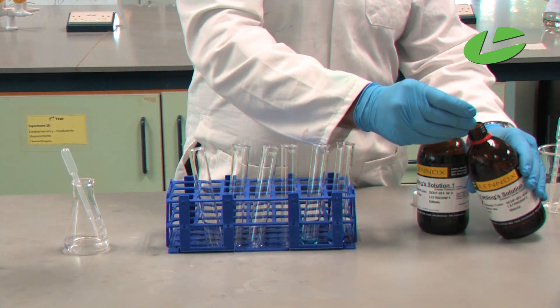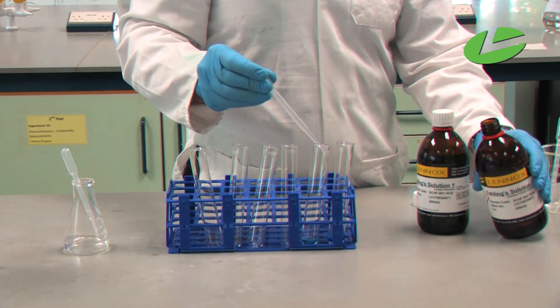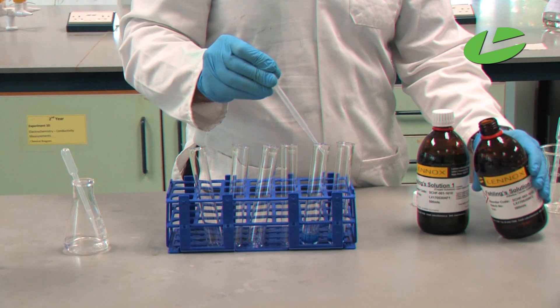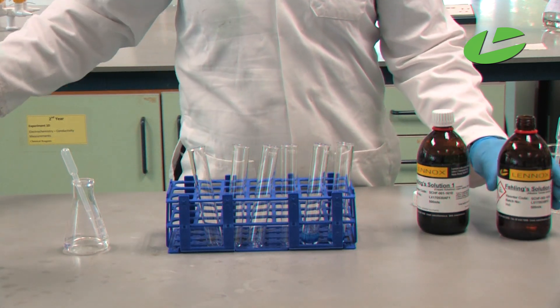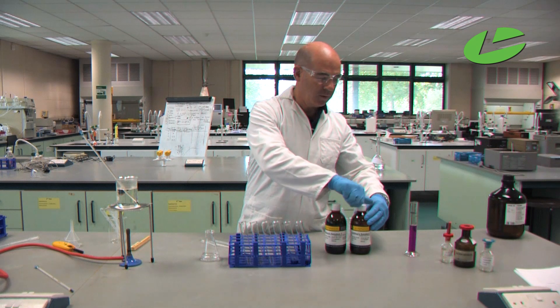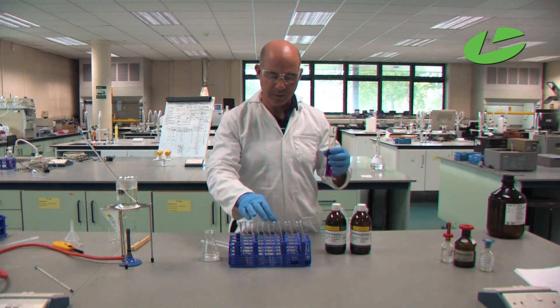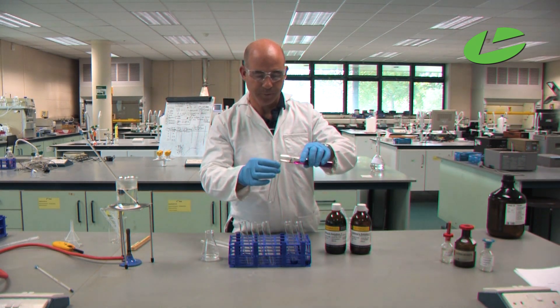The test tube on the left will be a reaction test tube. The one on the right can be our control. Here I have my acidified potassium permanganate.